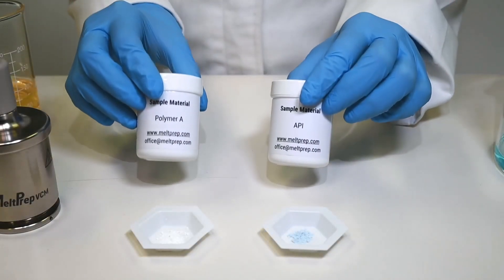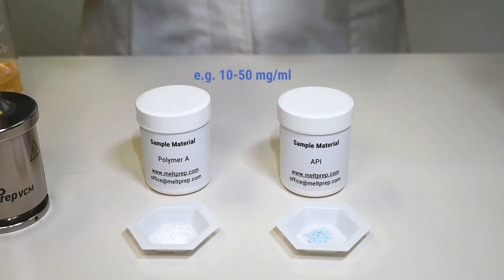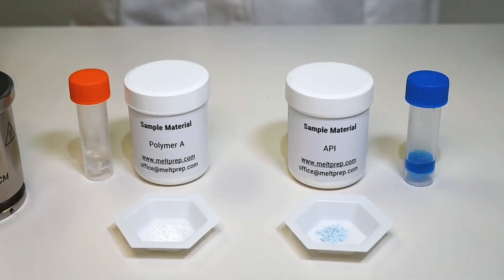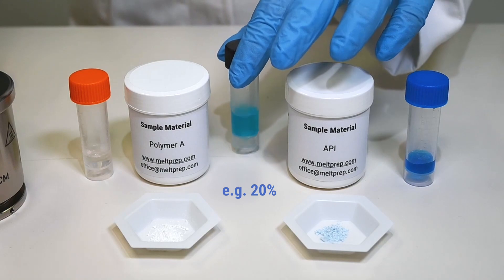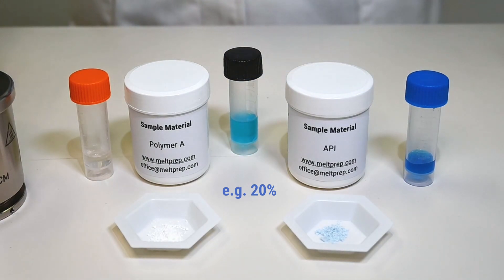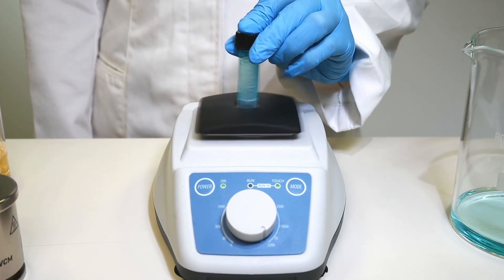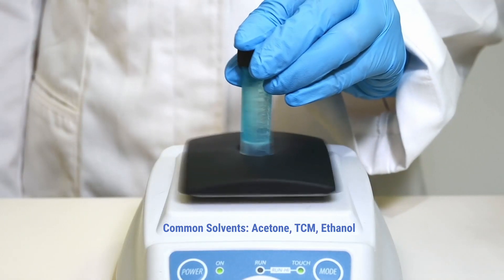Let us show you the melt prep approach to thin-film solvent casting. Take the ingredients and prepare stock solutions in desired concentrations. Prepare the required mixture. Mix the solution on a vortex mixer and obtain a fully transparent solution. Dilute with solvents if necessary.